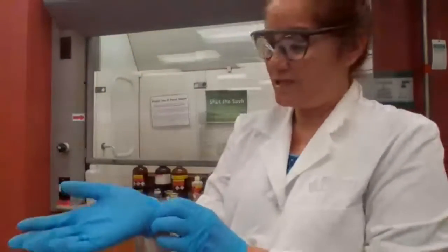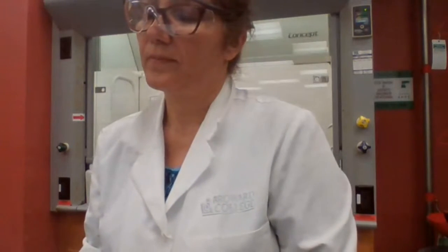Iodoform test. Which alcohol should I be worried about for the iodoform test? Do I have to do the iodoform test for all 3 alcohols, or which one do you think is going to give positive? For the known samples, if it was unknown, I would do it, of course, for the unknown. But for the known sample, only the OH group, when the OH group is on the second carbon. Okay, so it has to be the OH group on the second carbon, not just secondary.